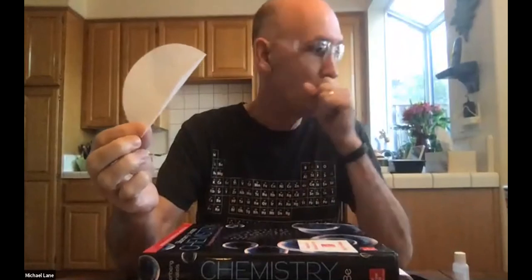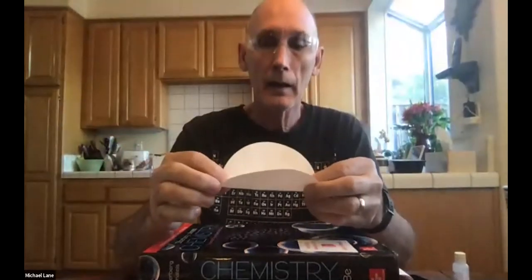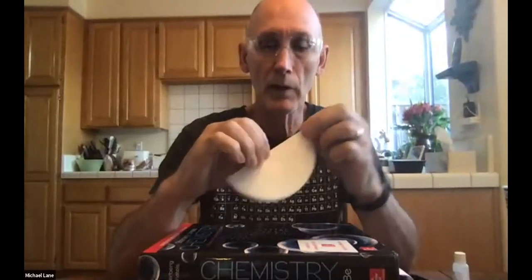The HOL procedure, excuse me, has some good pictures, but it doesn't point out some of the challenges here. So, mine came half folded, perhaps yours did as well. Give it a nice good crease halfway, and then fold it in half again. So we've got it now quartered. Give it a nice good crease, and then fold it in half one more time.